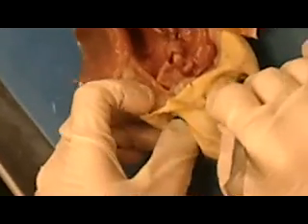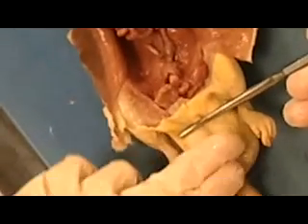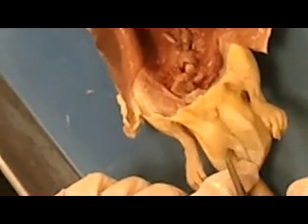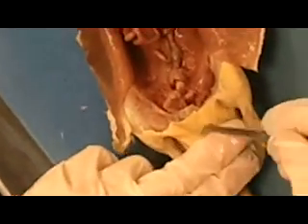Alright, and then we talked about looking at another way to tell that it's a boy. If you look again between his two back legs, if you remember from the female, she was more flat right across here. The male, however, has this large sac that comes out down between his legs, and on each side you can see one of the testes here and one of the testes over here. That is going to be the scrotum. The female, of course, lacks that part, so that's one way you can tell.